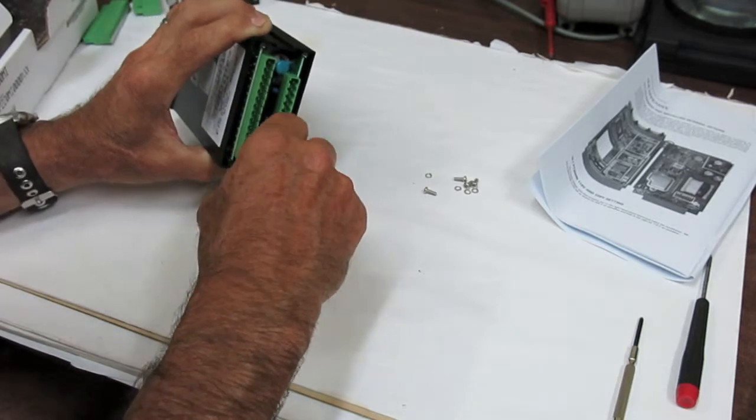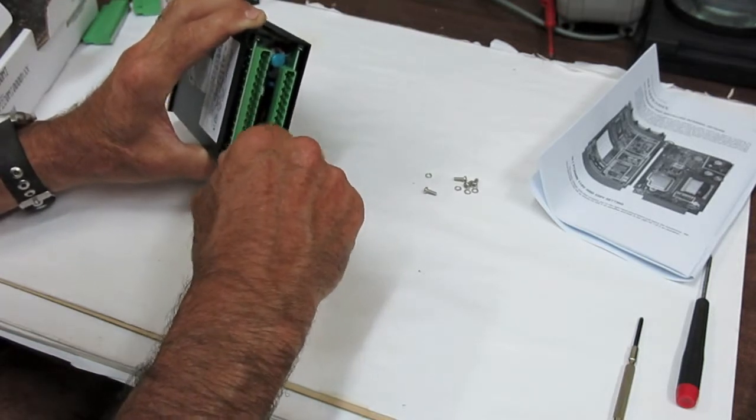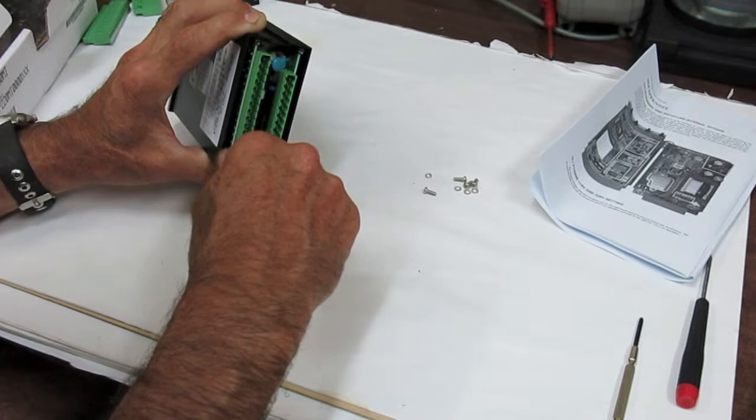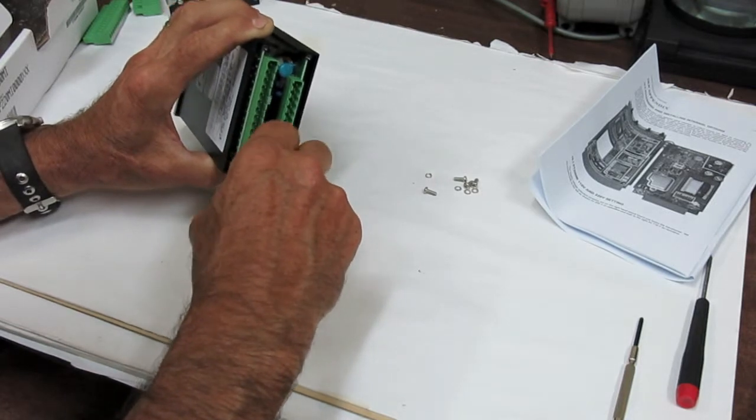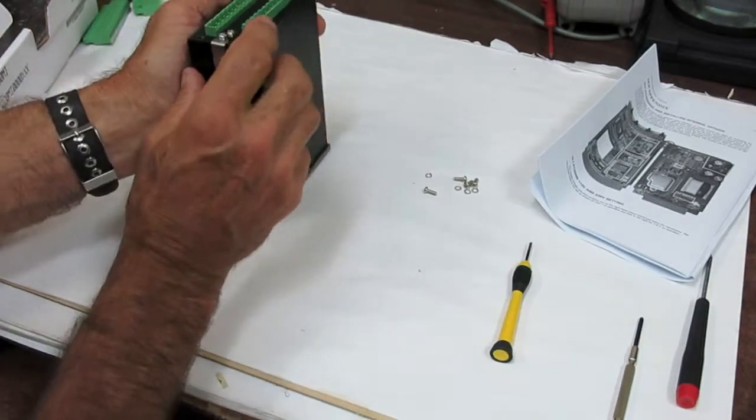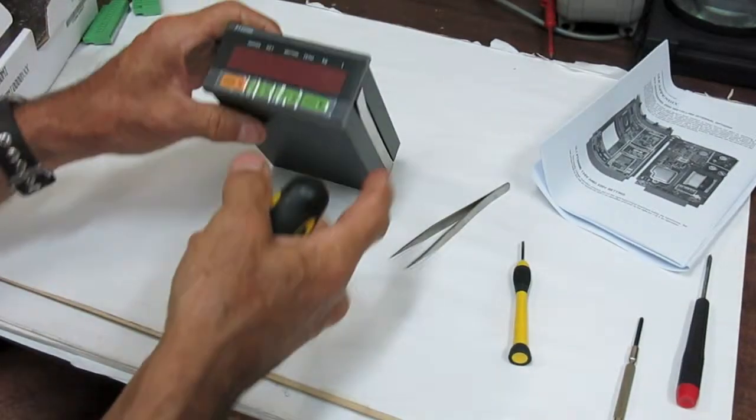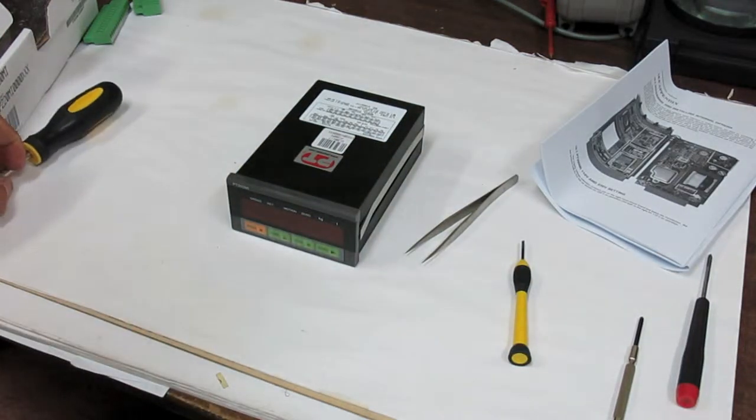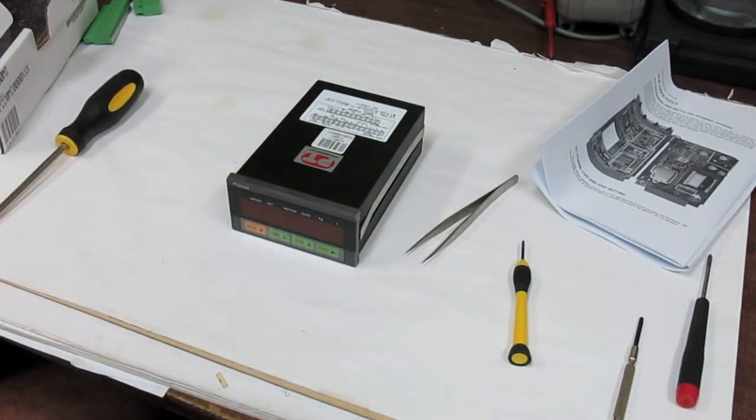Take care not to cross thread the screws. If they feel a little tight, ease back out and try again. Tighten the screws firmly into place but not over tight. Thank you.